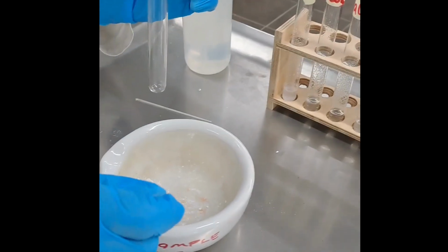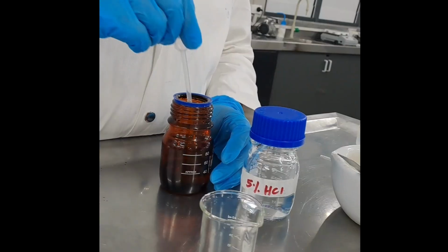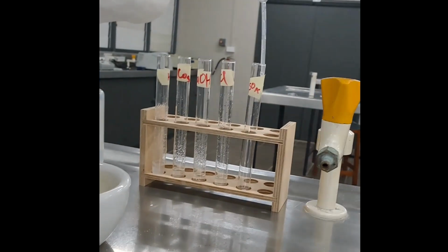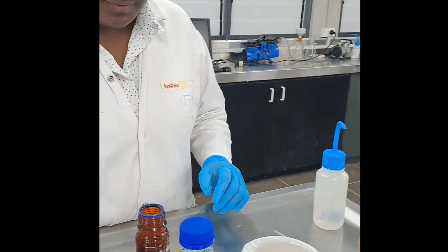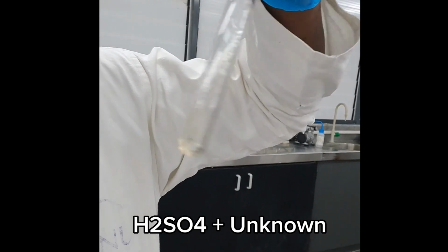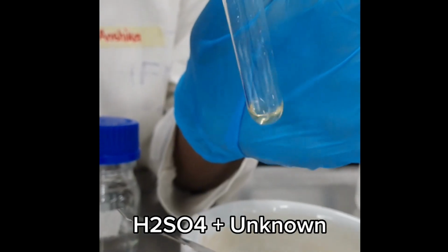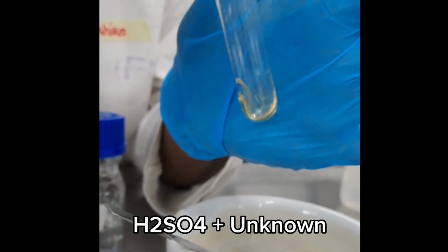Moving on to the last test. A small quantity of the unknown was added to the test tube labeled H2SO4. A few drops of H2SO4 were added to the test tube. The test tube was shaken properly and observed. An instant color change can be seen in the test tube. Precipitate and bubble formation was also observed.